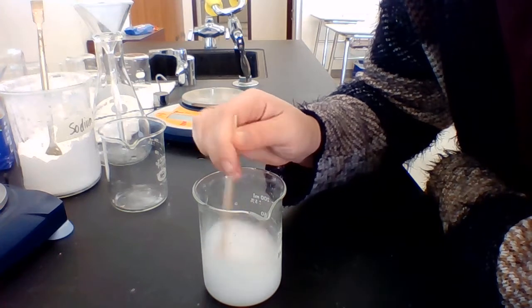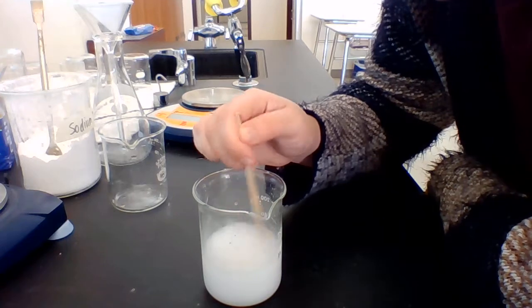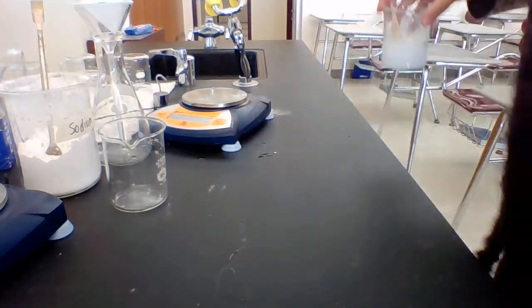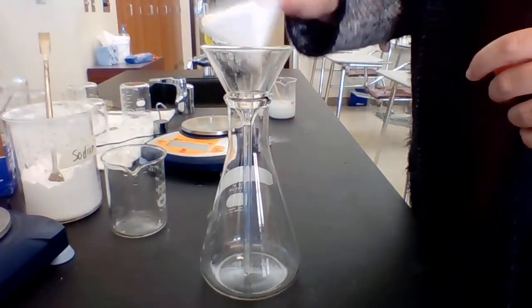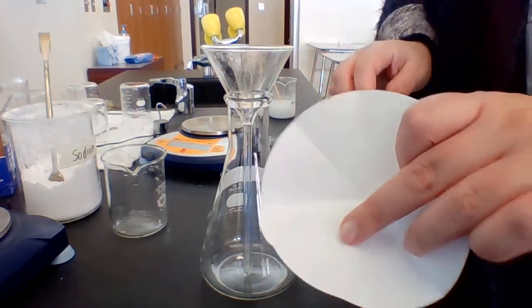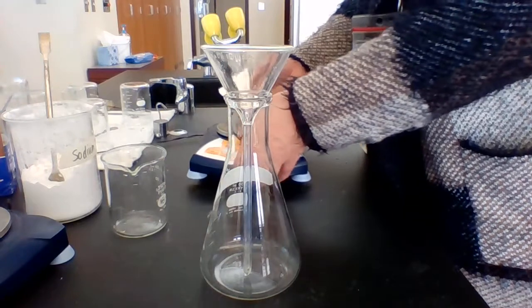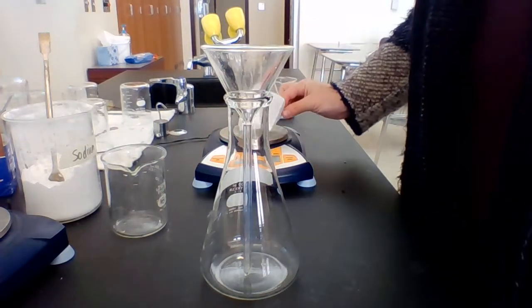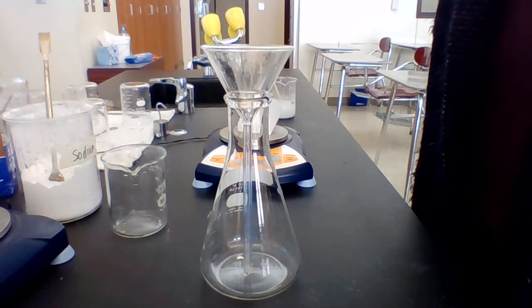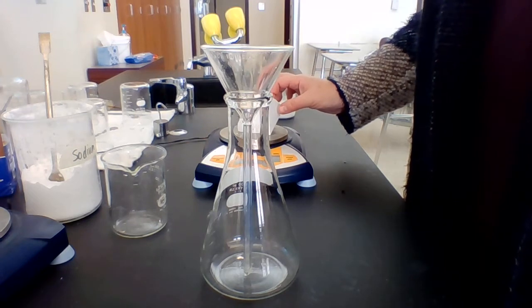We do have one more thing to do, though, before we move on, and that is I'll show you our apparatus, what we're going to be dealing with here. So here I have a flask with a funnel in it and a piece of filter paper. The filter paper is going to filter out the product. Now, before I do this, since I'm going to measure this in the filter paper, I have to get the mass of the empty filter paper, without anything in it. And I just put that on the scale. The filter paper is 1.14 grams.